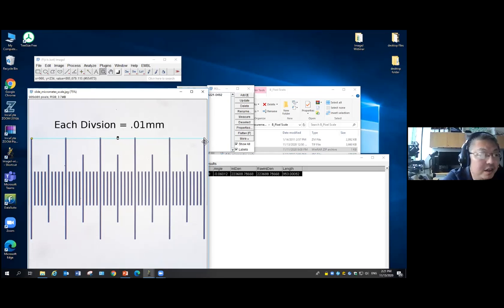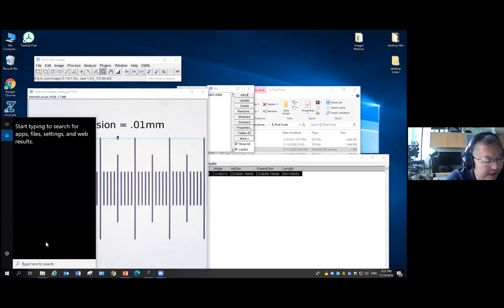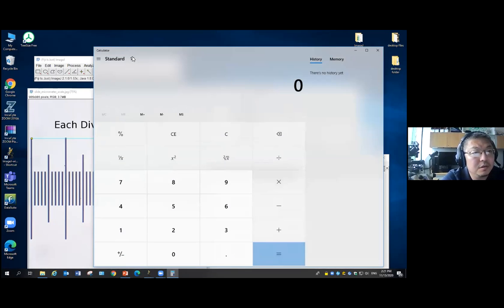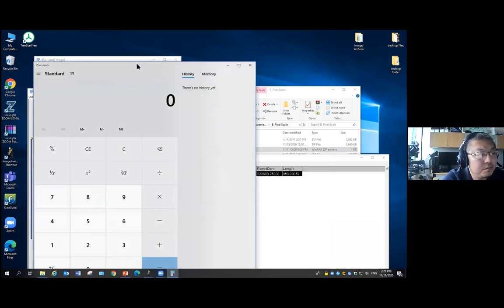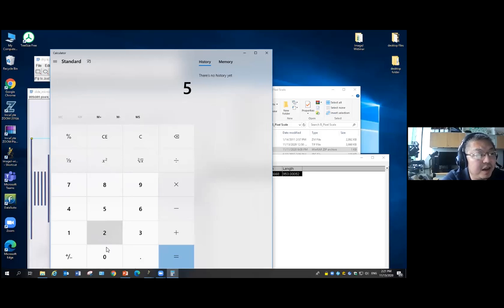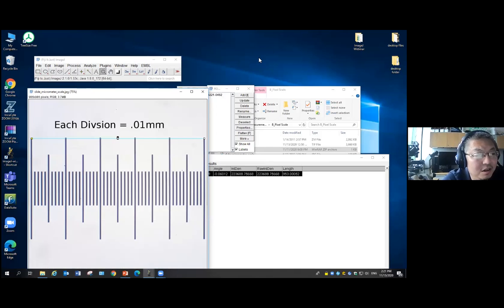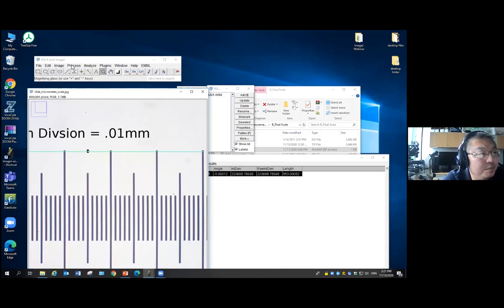So now what we can do is calculate this. Let me see if we can find the calculator. So this length is 500 microns, and it's 953 pixels. So 500 divided by 953. Each single pixel corresponds to about 0.525 micron.